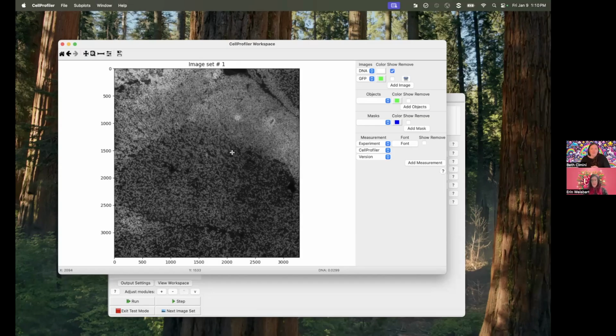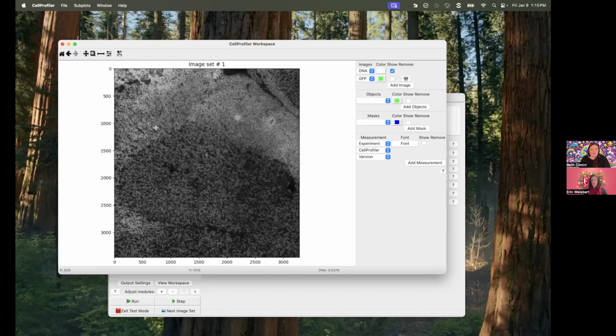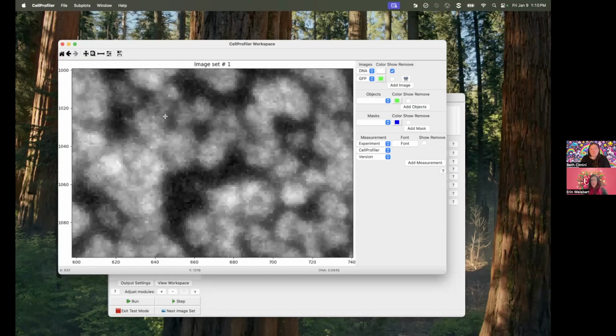And so actually segmenting individual nuclei, assuming that the individual nuclei are about the same size, which they seem to me at first glance to be sort of 15-ish, 20-ish pixels across in both areas, I think would probably actually kind of work. But that's ultimately up to Susan and her biological question, which she can figure out later.